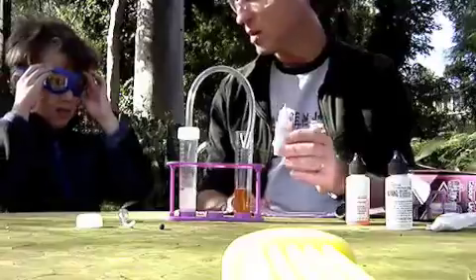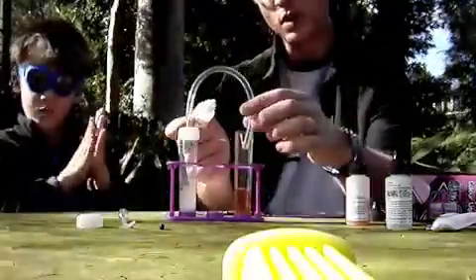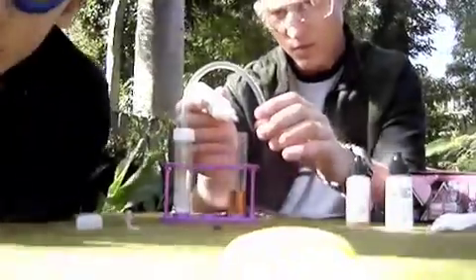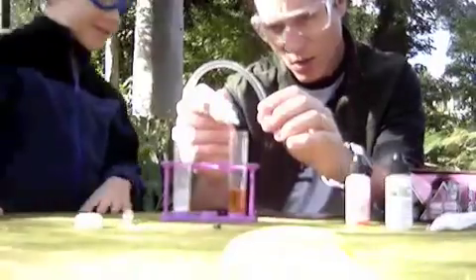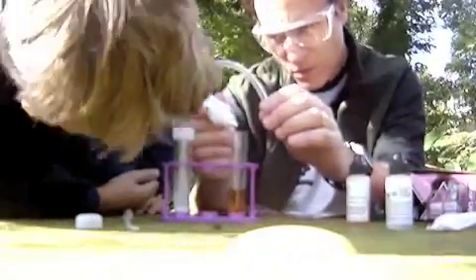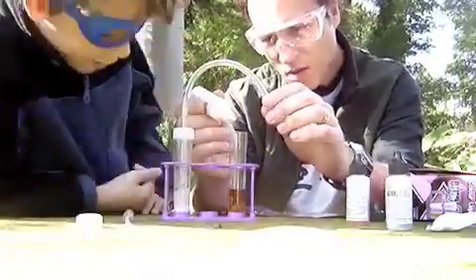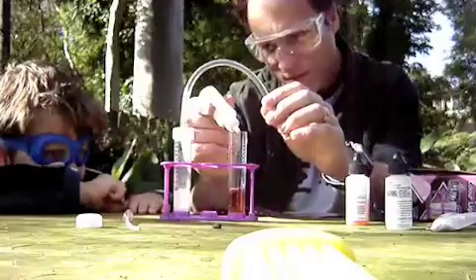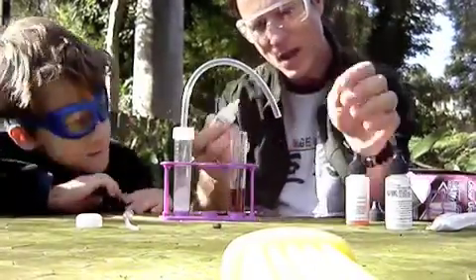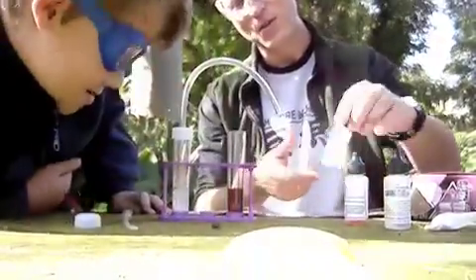Now we're going to add some calcium hydroxide solution. That's going to make the indication of the color change once again. Here we go — this is so crazy! One drop, two drops... What's happening? Look at that! What color is that? Brown? Take your goggles off.